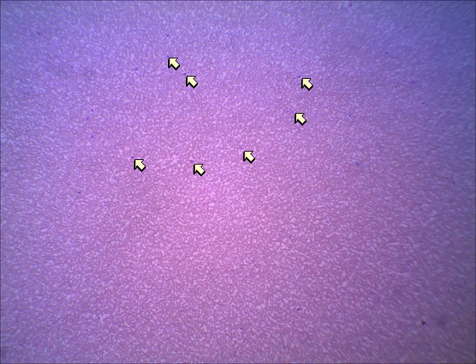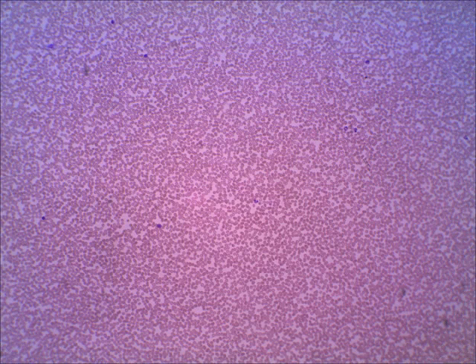And you cannot tell what a white blood cell is or what type it is unless you put it on a higher power. So this next slide is zooming in just a little bit more. Now we're on low power. It's still pretty hard to tell what kind of white blood cells we're seeing unless you're really trained in this. You see lots of red blood cells.